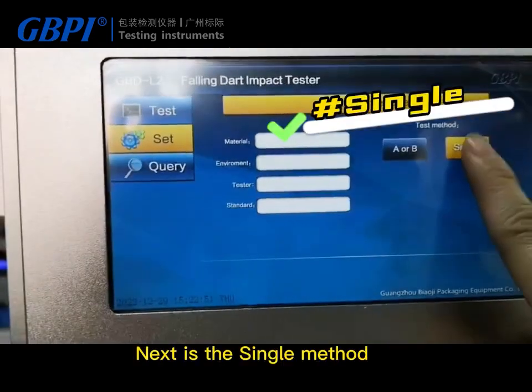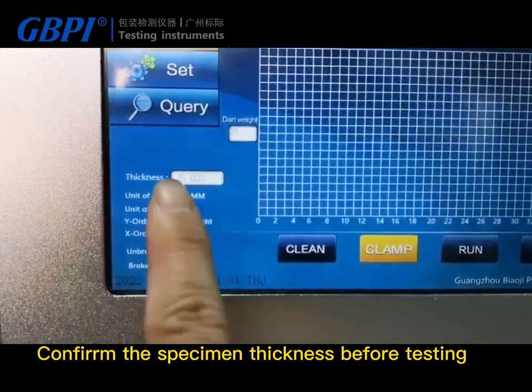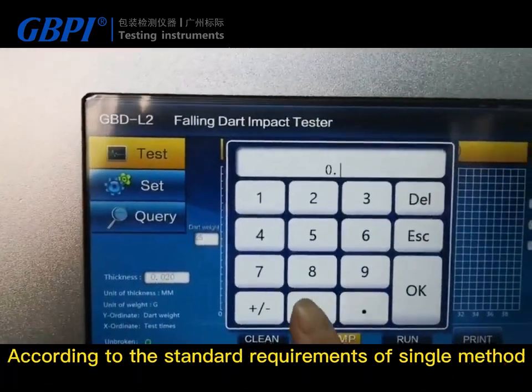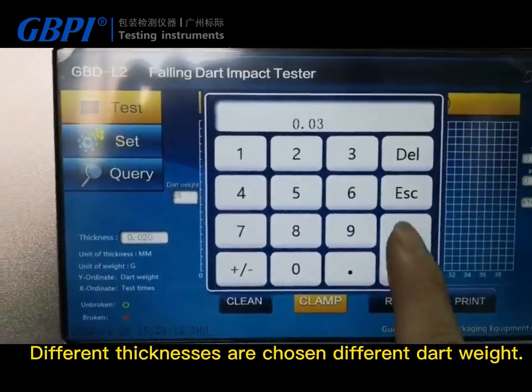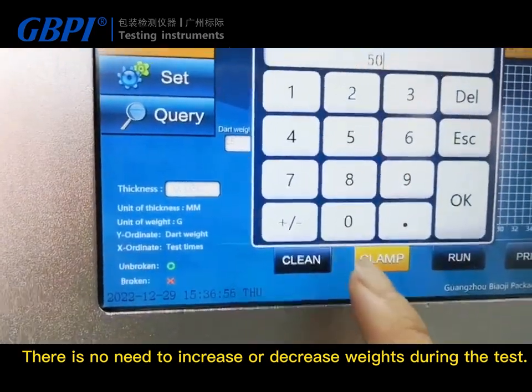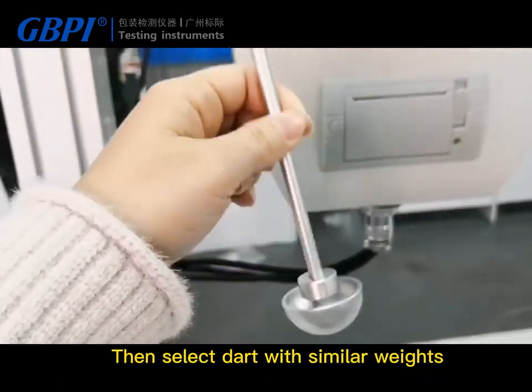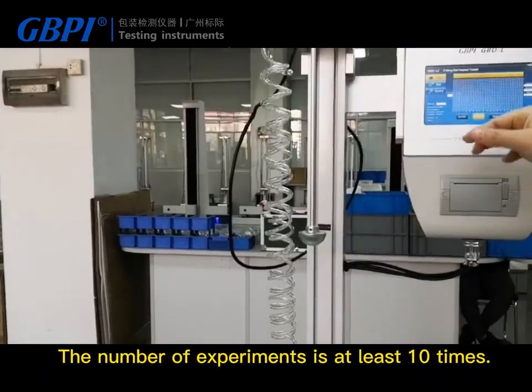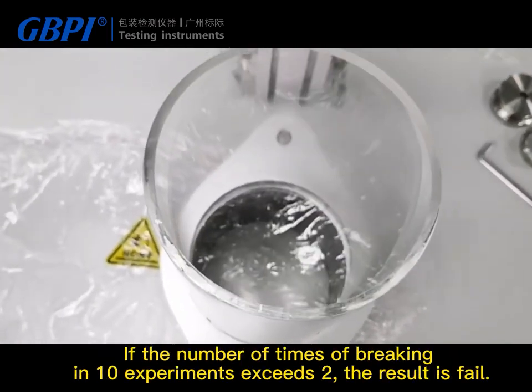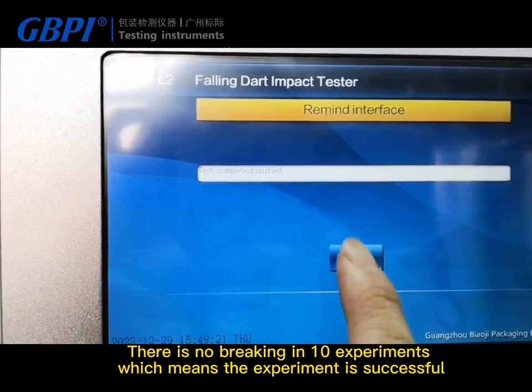Next is the single method. The thickness of the specimen determines the dart weight, so confirm the specimen thickness before testing. According to the standard requirements of the single method, different thicknesses require different dart weights. The dart weight is fixed, so there is no need to increase or decrease weights during the test. Select a dart with the appropriate weight. The number of experiments must be at least 10 times. If the number of breaks in 10 experiments exceeds 2, the result is fail. If there are no breaks in 10 experiments, the experiment is successful.